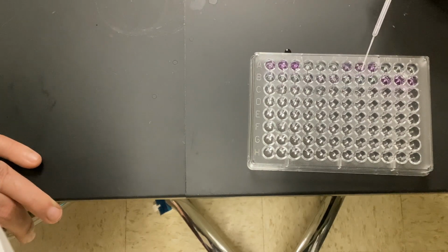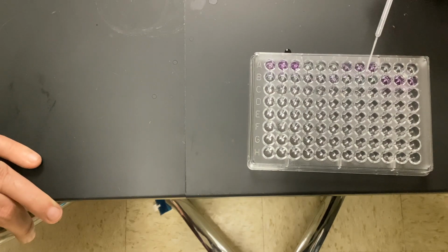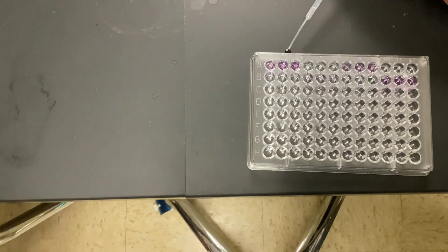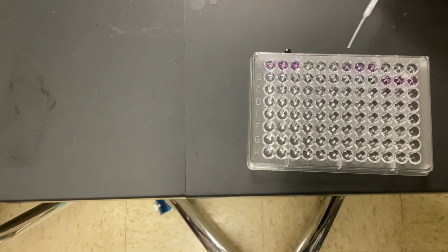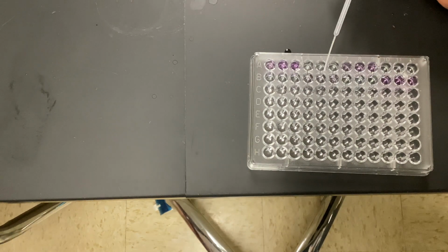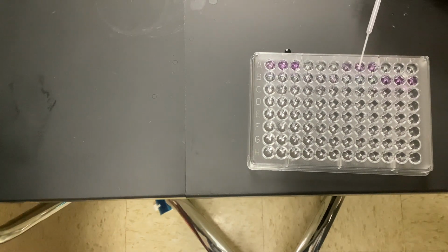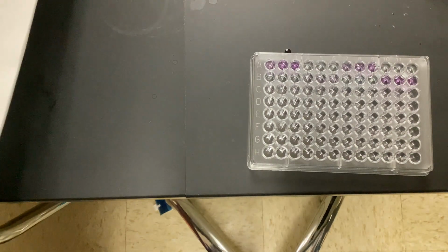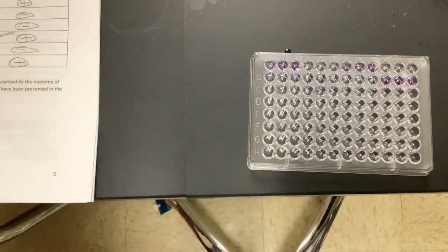All right, E, I don't see anything. But F, I definitely see. That's probably the strongest. That's actually even stronger than the positive control. So I'm going to say A and D are light, E is nothing, and F is strong. All right, I'm going to just stop the video for a second.